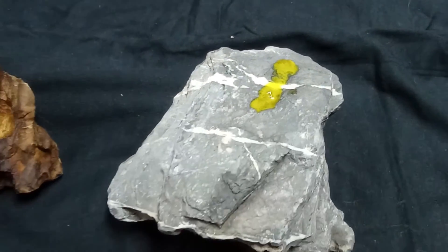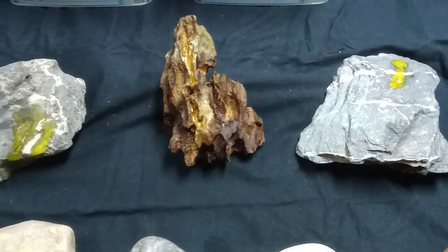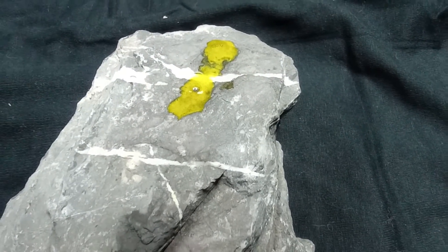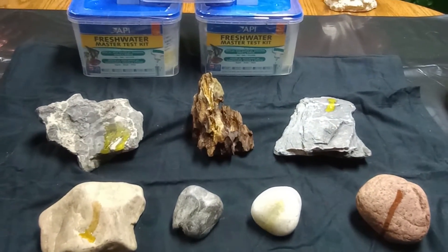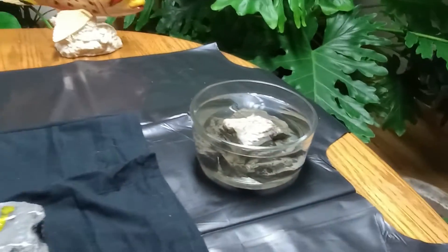The chemical we're using out of this test kit is actually an acid that reacts with carbonates and bicarbonates, and that's the reaction that we're seeing. That will increase the pH; however, your pH will top out usually right around 8.2 to 8.4.